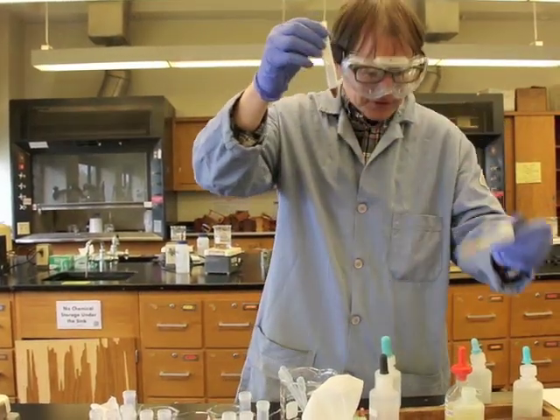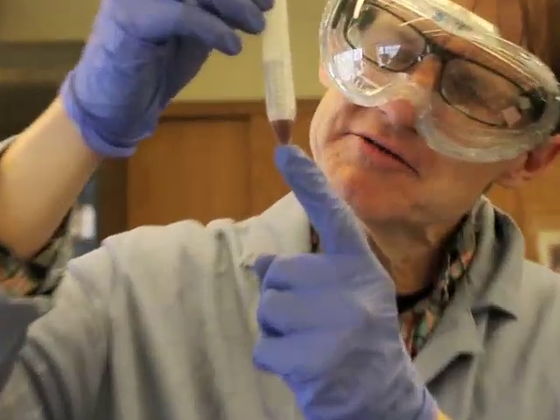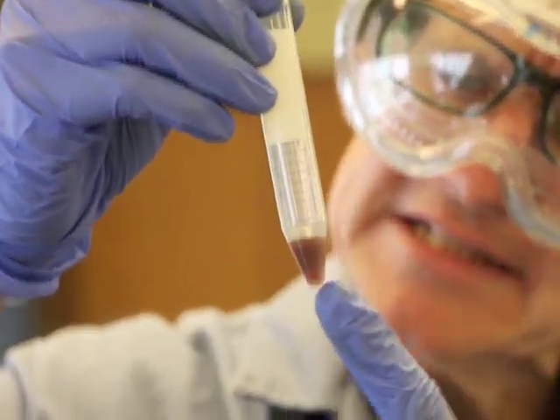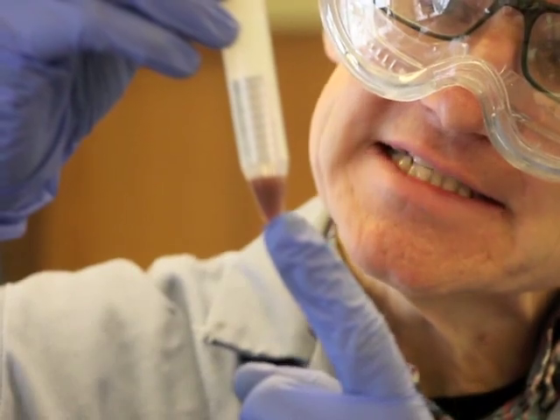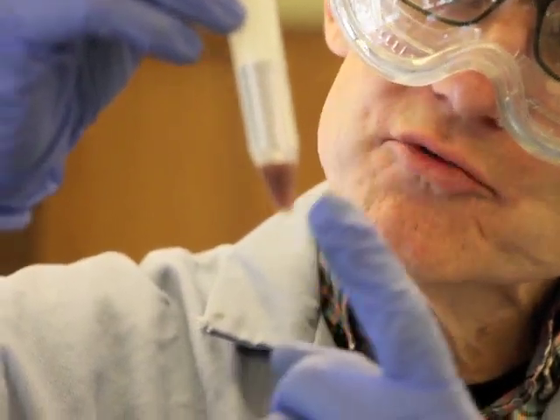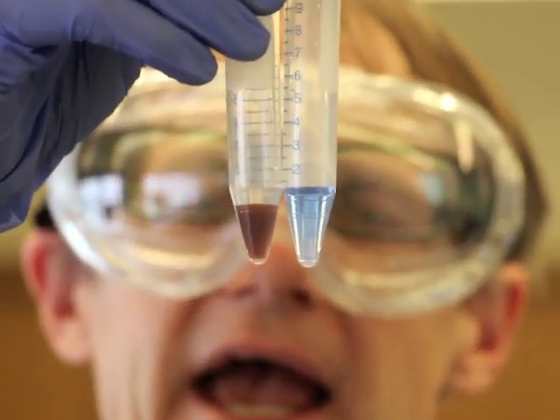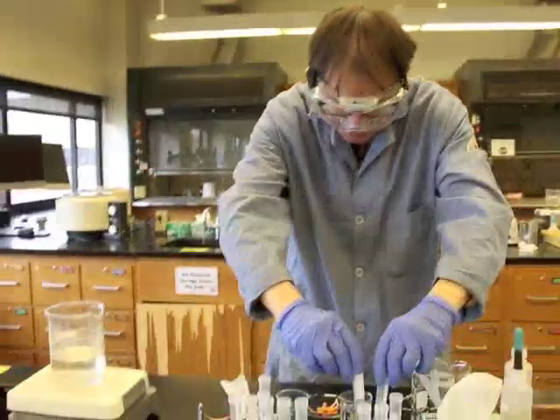And it says to centrifuge. The presence of a dark red precipitate. Now take a look at that. That's definitely dark red. So we could go ahead and centrifuge this in order to see it. But if you take a look at that, that is definitely dark red. So we've got a positive test there. So both the ammonium hydroxide test and the potassium ferrocyanide test give us positive results. They should be complementary to each other.